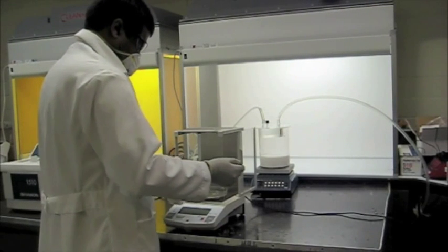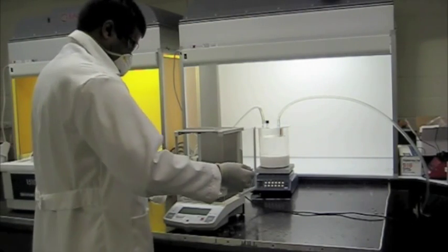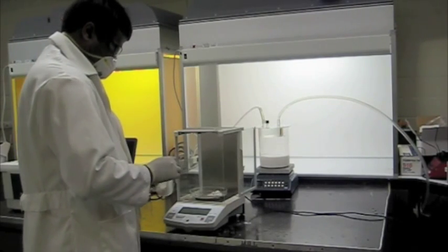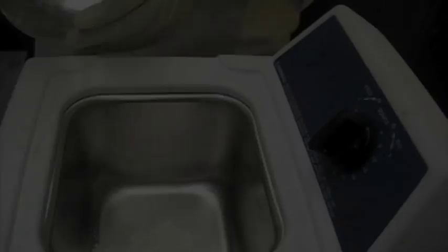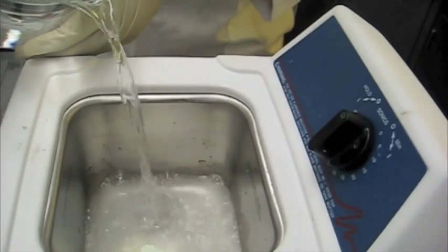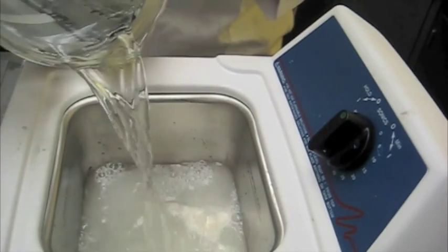The initial step involved in the synthesis of nanofluids is to mix the particles in DI water. In this experiment, aluminum oxide nanoparticles, approximately 100 nanometers in diameter, are mixed in DI water. 10 grams of the nanoparticles are weighed on a highly precise weighing station and are mixed in 990 grams of DI water.